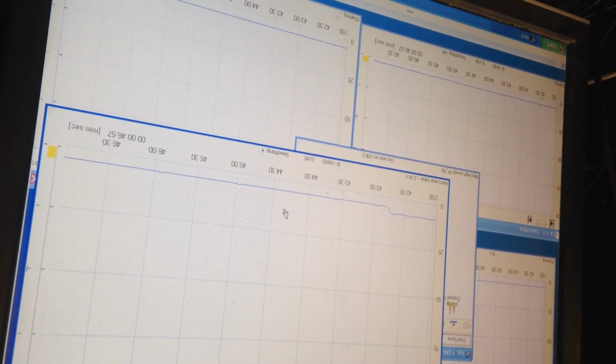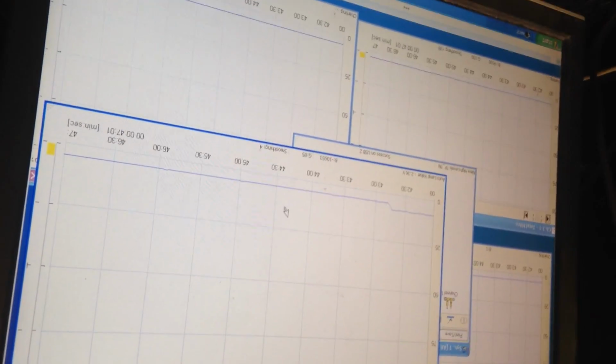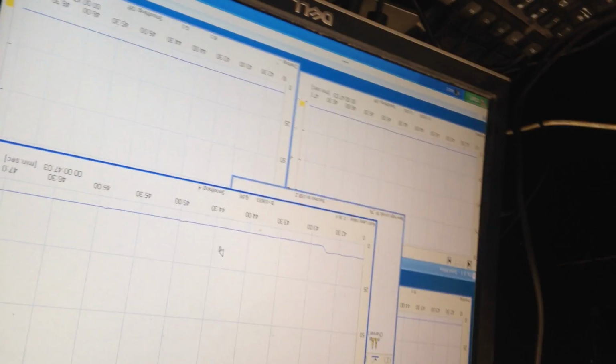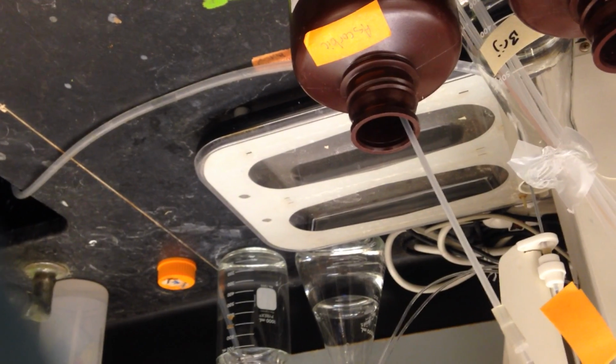Cancel, go back to your window, writing down the baseline with the reagents. So we have that. Where'd you get the number? Oh, it's negative. So now once that's done, we can go back and have some confidence that everything's gonna work.